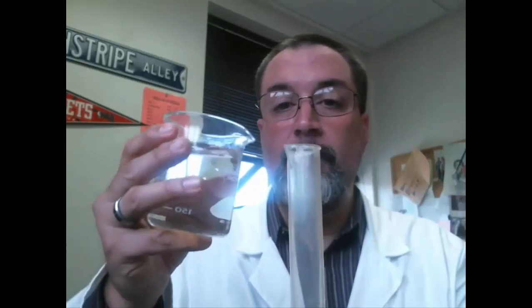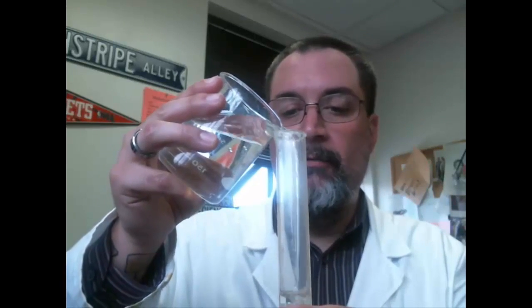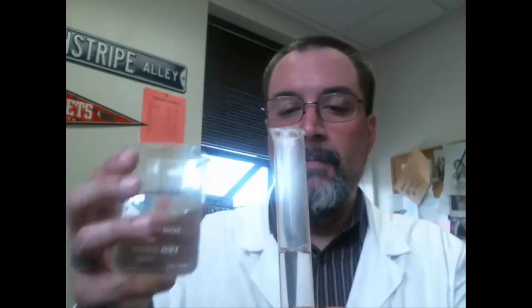And we're going to do this little copper cylinder. So it doesn't matter how much you put in, just make sure that you have enough to completely submerge it. So I'm going to add a little bit, fill it about halfway full.